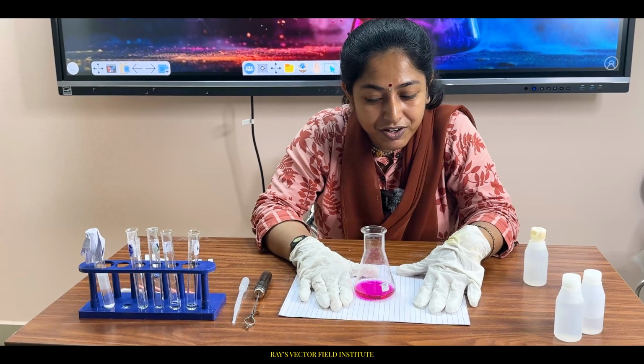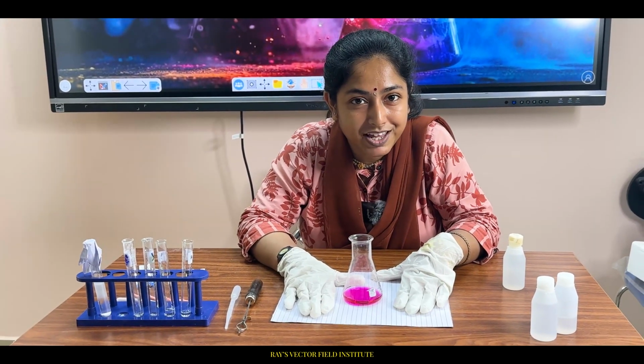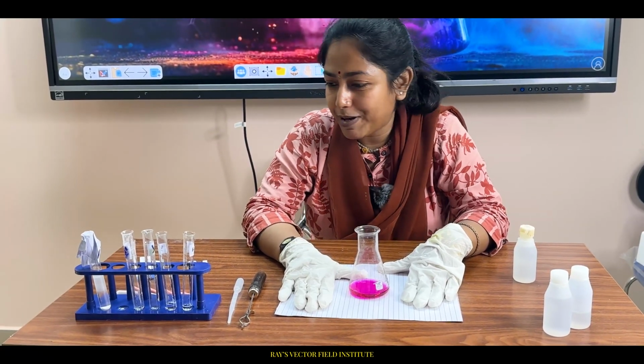Now let's reveal one by one each step of this acid base reaction. You are enjoying it, right? Be in this experiment with me.